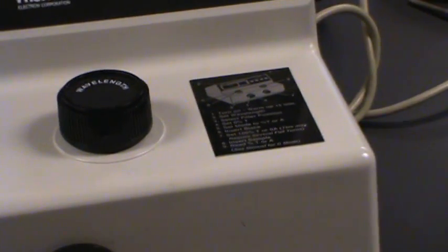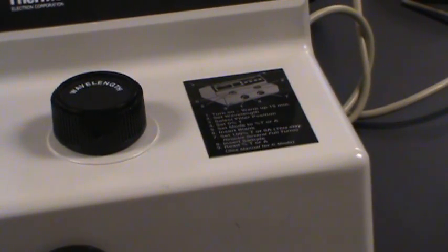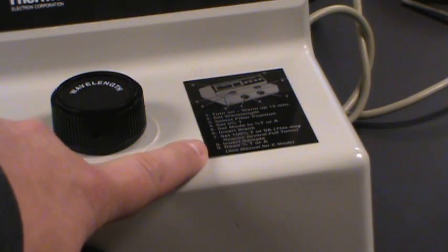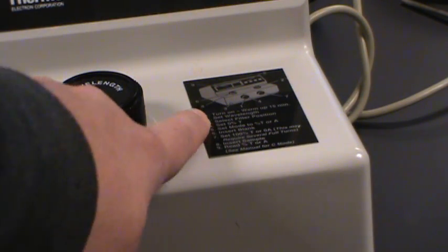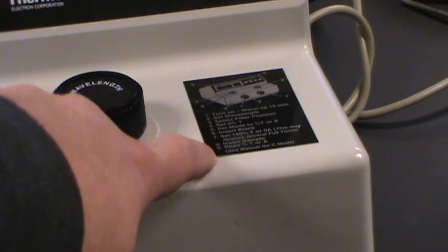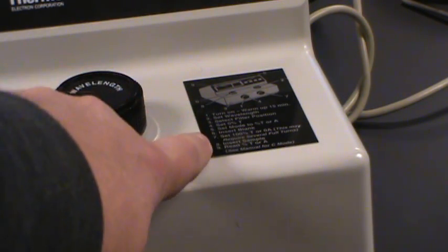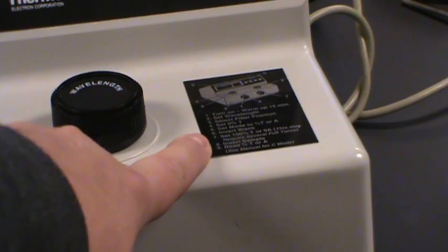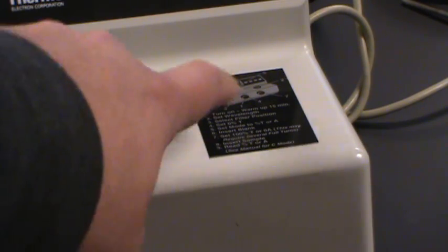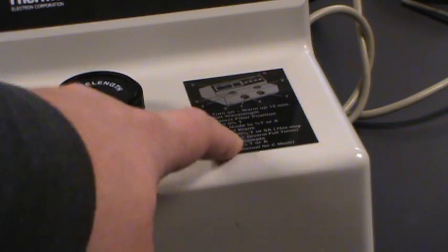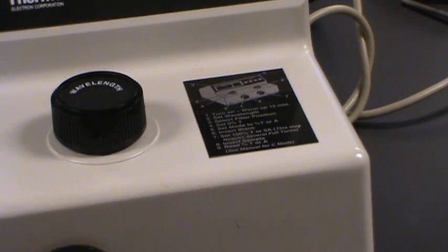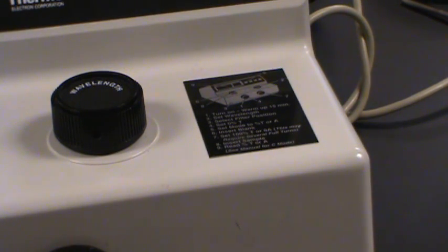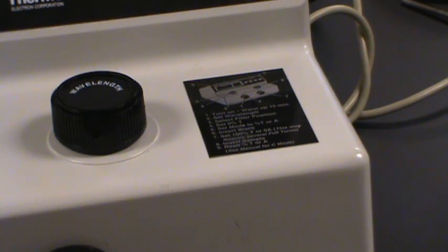Also don't ignore this little panel. This little panel gives you instructions for calibrating. We'll talk about that more specifically in a few minutes but the instructions are right there on the instrument. So that's one of the many places you're going to have that'll help you find how to calibrate your instrument.